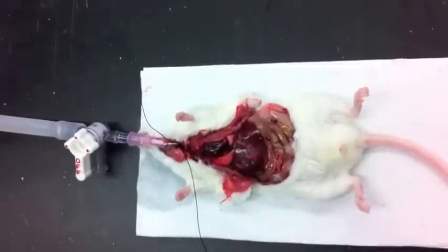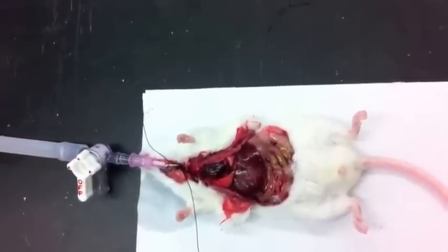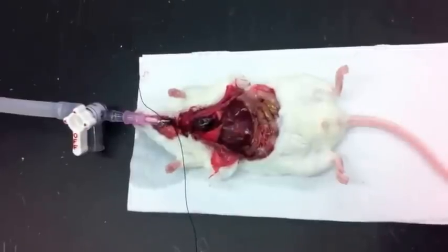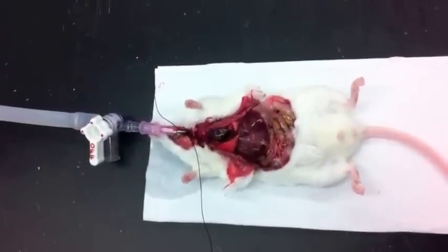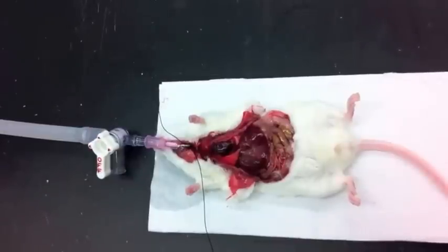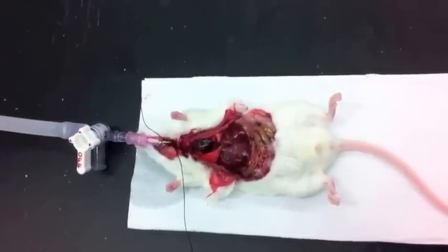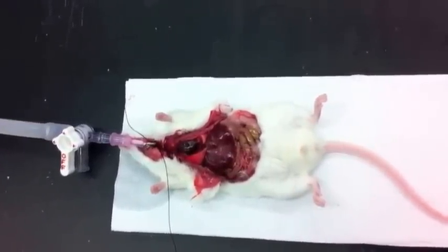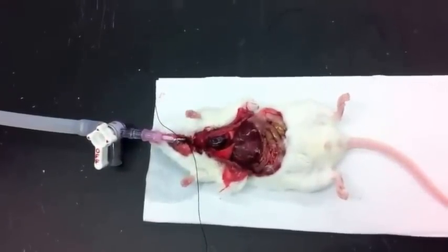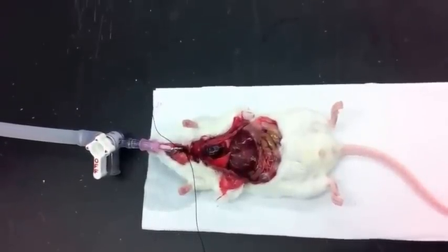That's the advantage of doing it this way — you can see the lung inflate under the head of pressure of 25 centimeters of water. Sometimes if there are bubbles you won't see it inflate. We'll let this stay for at least five minutes. The actual time is somewhat variable but should be consistent across all experiments — it could be as long as 15 minutes, and some people leave it overnight under pressure using a manifold system, but at least five minutes is needed to ensure adequate filling of all regions of the lung.